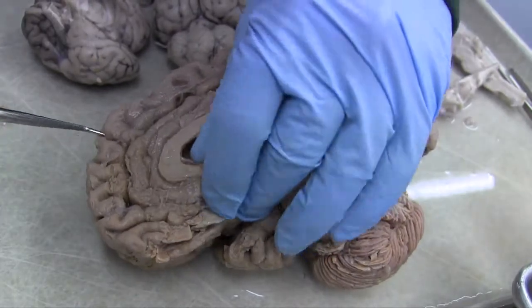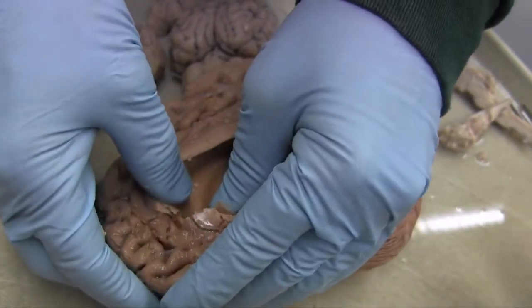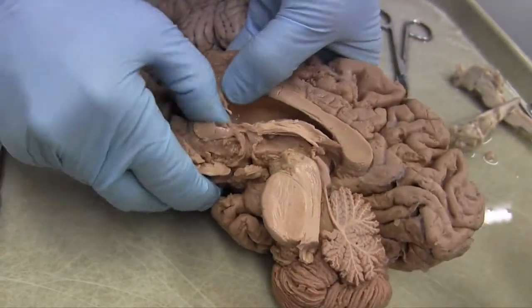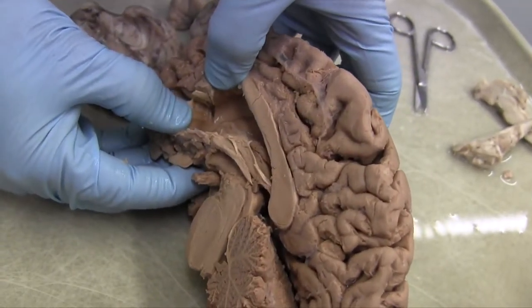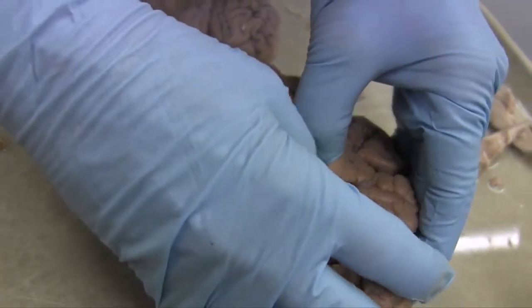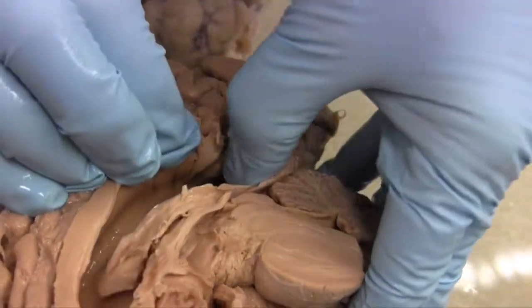Okay, so now let's follow the lateral ventricle, and there's no good way to do this except to sort of dissect it by tearing it. You can see it goes all the way forward to this frontal pole. Do you see that? That's the end of it. So it's going all the way forward, but the really cool part is as we go backwards. And so we're gonna follow it as it goes backwards. Look at that. I mean, it's very pretty.